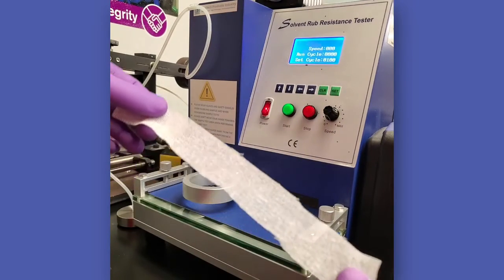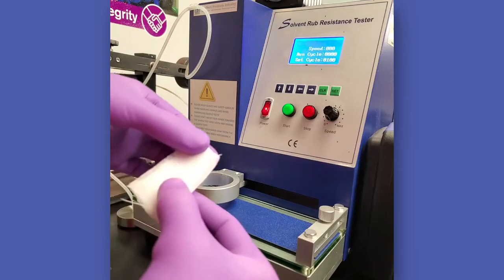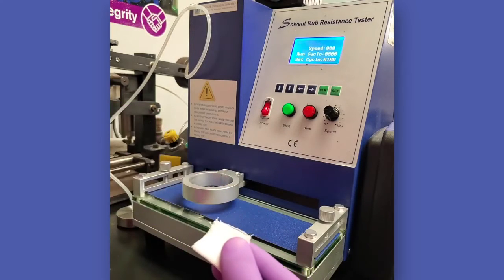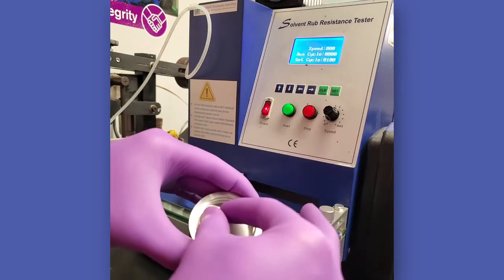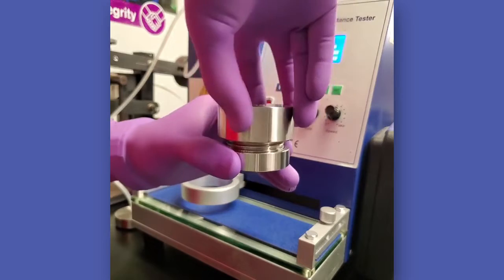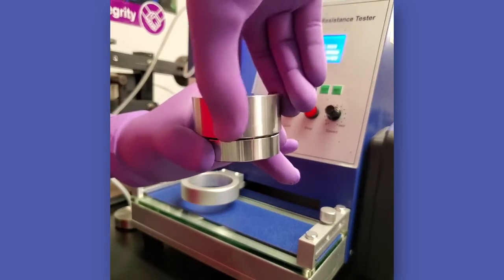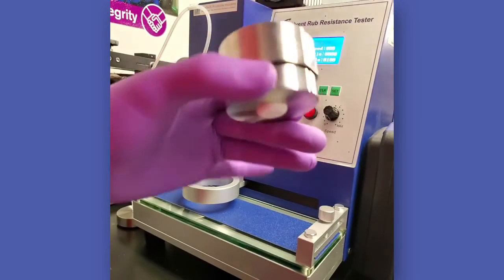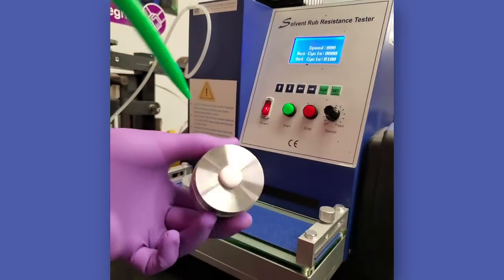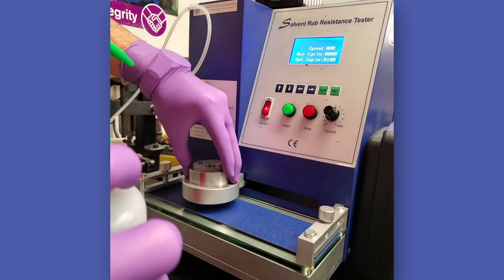Select the agreed-upon solvent for the test, and be sure that the solvent reservoir is filled as recommended by the rub machine equipment manufacturer and that the pump setting is correct. If not, too much or not enough solvent may be delivered to the testing pad, which may lead to false results. And place the probe with cheesecloth or other agreed-upon material in position on the test panel. Be sure the cloth is saturated with solvent from the reservoir, or that it has been primed with solvent using a squeeze bottle to wet the cloth before use.